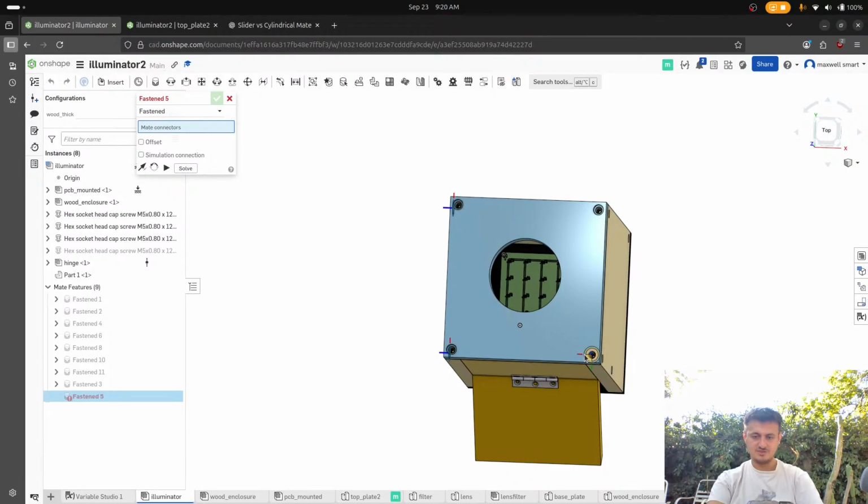We want to figure out the distance between this screw, the 1/4-20 screw plane, and the mid plane of the lens. How are we going to do that? I think I'm just going to take a depth measurement and just kind of eyeball it. I don't like this type of CAD. I like the type of CAD where you know it's right. But sometimes you don't always have that luxury.